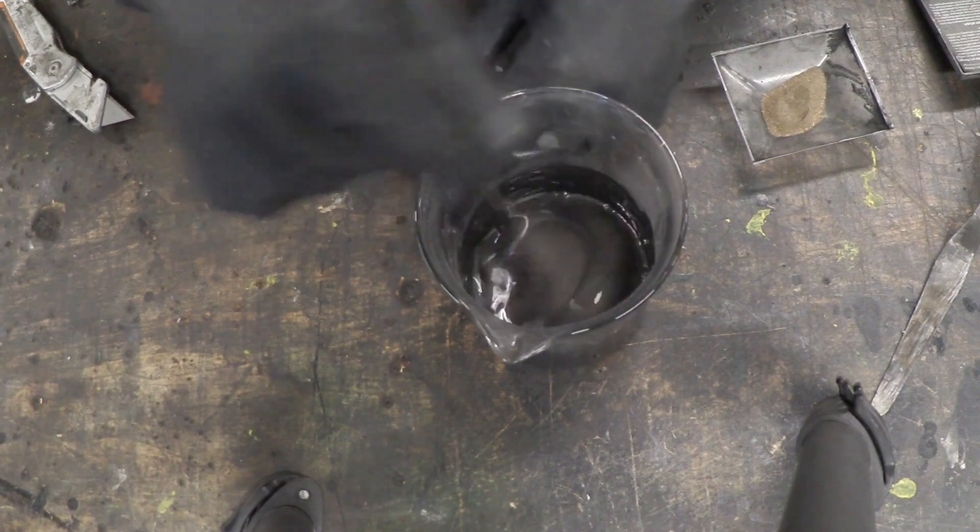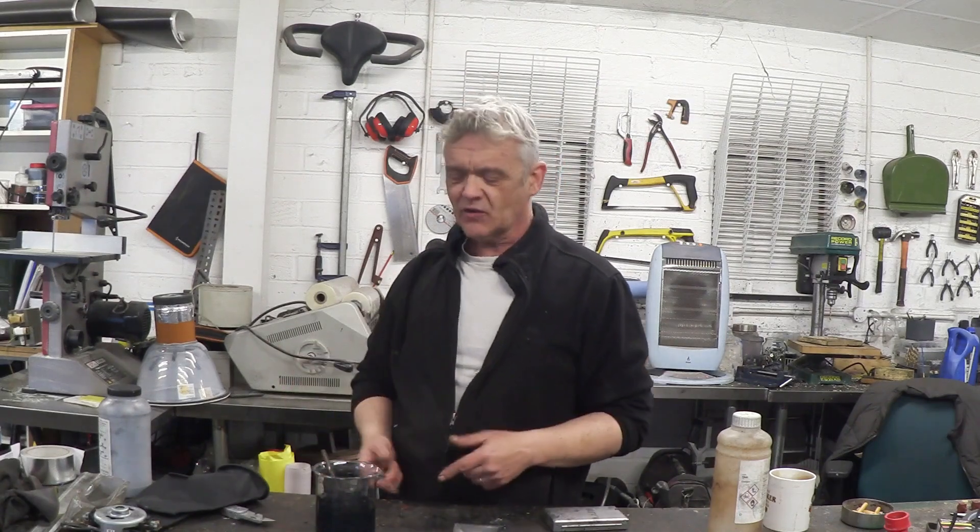So it's that kind of amount you add at a time. So what I'm after is something called SAIGO, which is sulfuric acid intercalated graphite oxide. What I've done is mixed 100 millilitres of sulfuric acid, 50 grams of graphite, and 5 grams of potassium permanganate in this jar, which is what I've been stirring like crazy. Now it's got a kind of deep blue color, which is why they call it blue graphite.